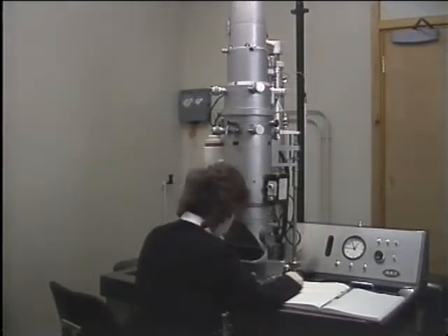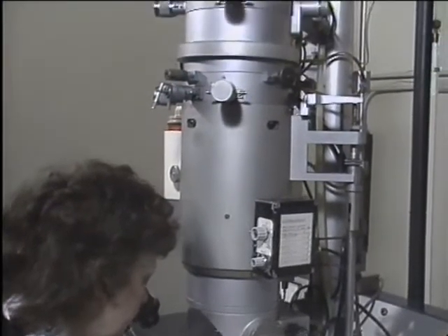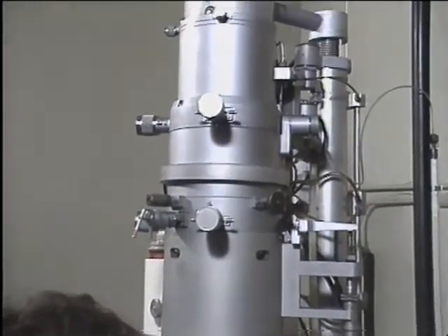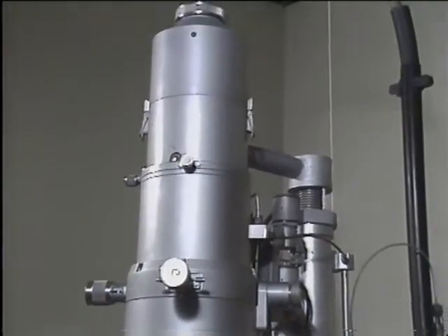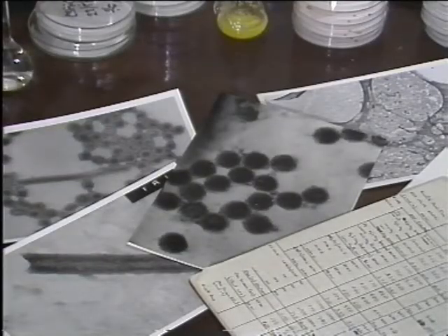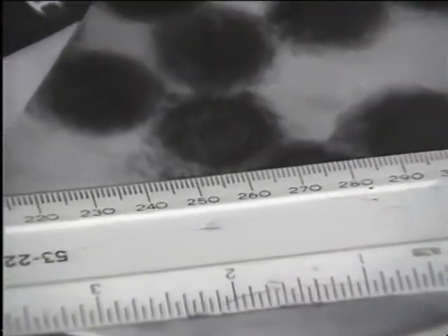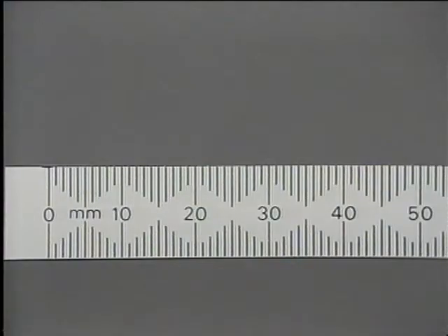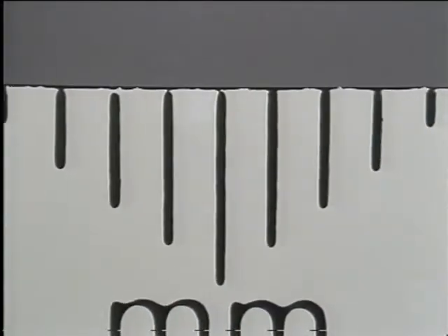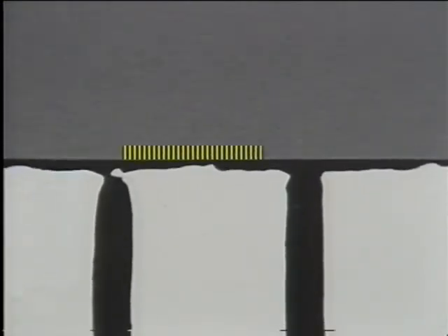During the last 40 years, the electron microscope has become one of the most important tools in the study of biology and biochemistry. To understand why, you have to think about the size of cells and molecules. Most cells are several times smaller than the tiniest thing you can see with your eyes. Animal cells, for example, are only about 20 micrometers in diameter. So a millimeter would stretch across 50 of them. To see them at all, you have to use a microscope.